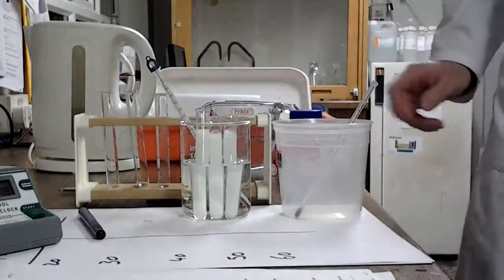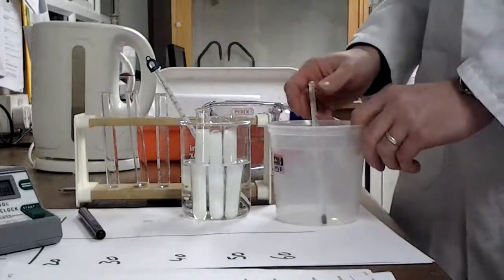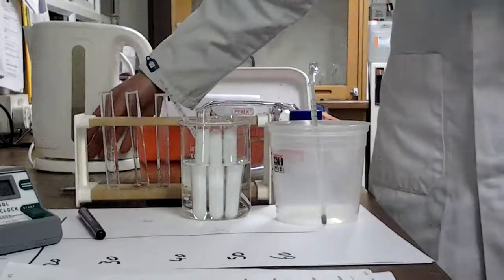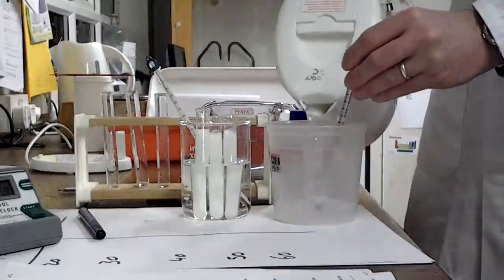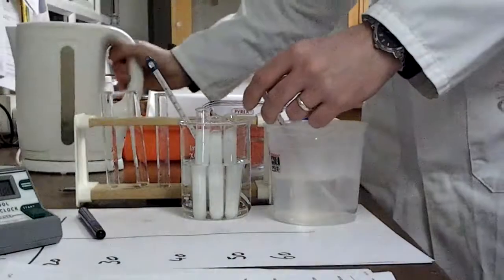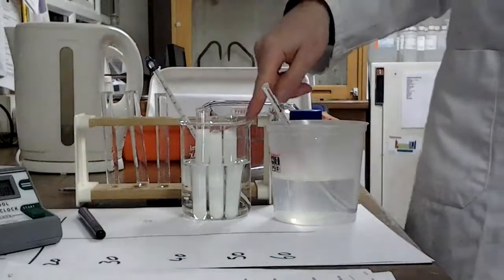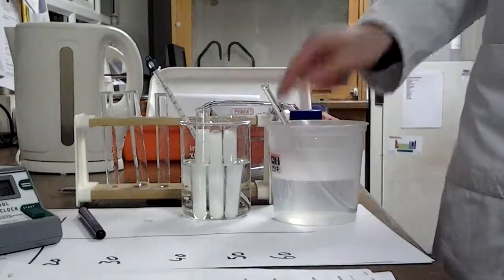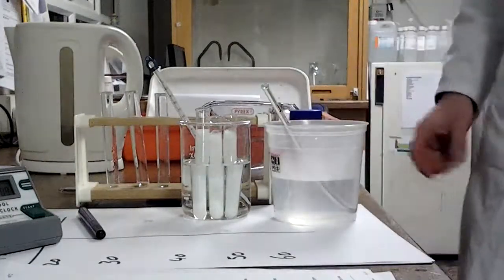It's 30 degrees. So we're going to need to make a water bath at a higher temperature. So this is where I'll be doing this water bath. And of course you're going to use a kettle. Now you need to be aware that whatever I put in here, whatever temperature it's at, let's have a little look. It's not going to stay that constant, is it? Because we took 10 minutes for equilibration and now there's going to be quite a while for this experiment to take place. The temperature of this is going to tend to decline back towards room temperature. So you will need to keep an eye on it.